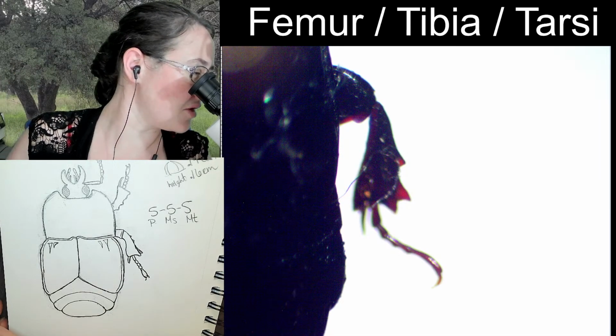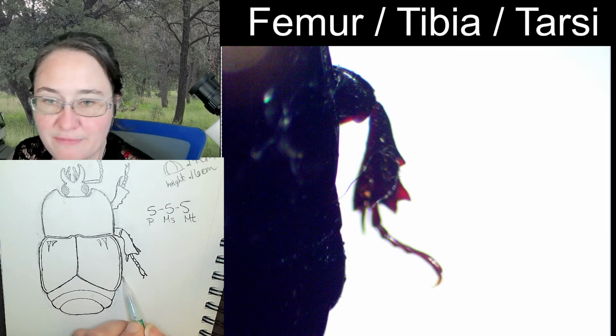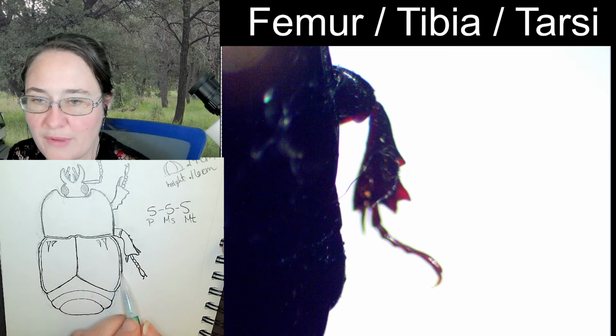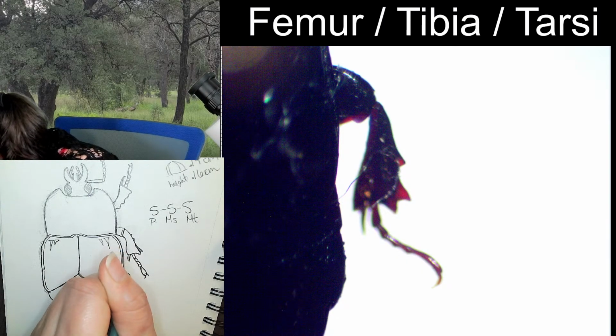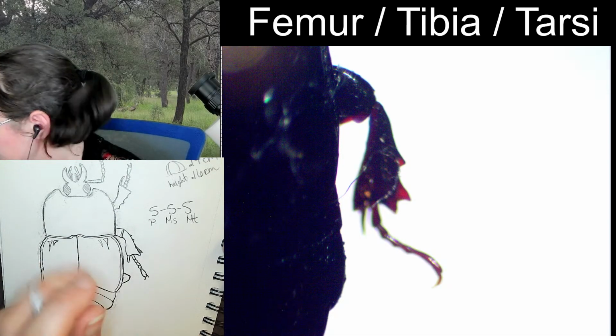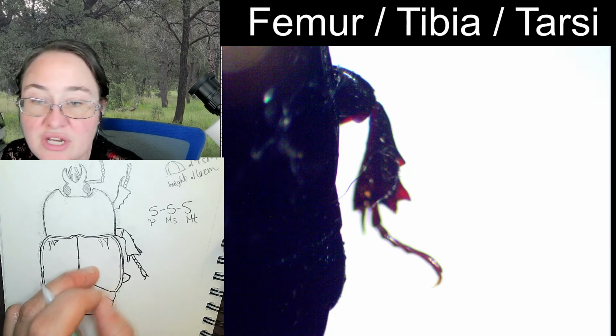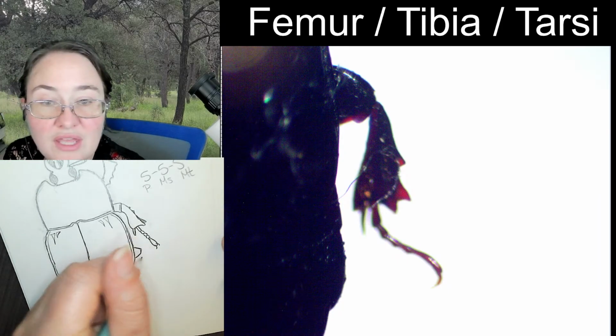This leg comes out from the side of the body right about here, kind of at the base of where the elytra are starting to end. So I'm going to add this femur here. Keep in mind the femur is actually connected closer to the center of the body. Then we get the tibia.